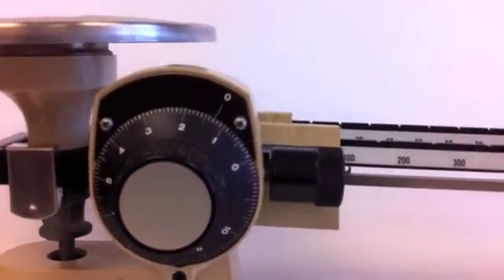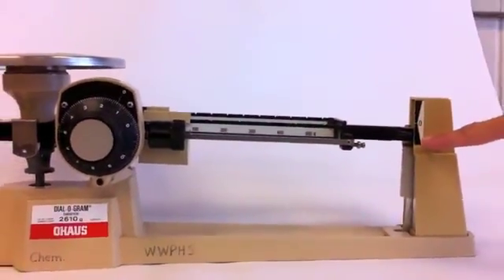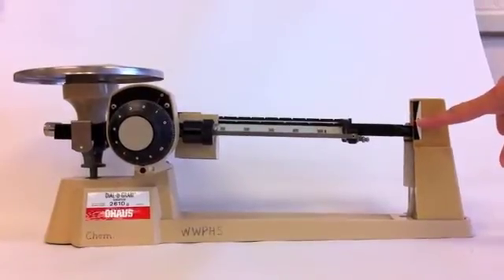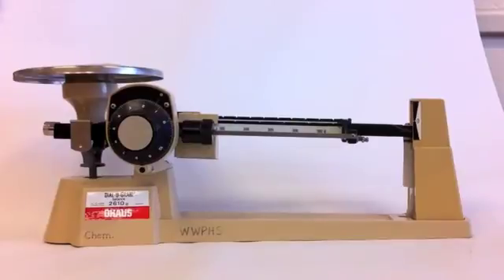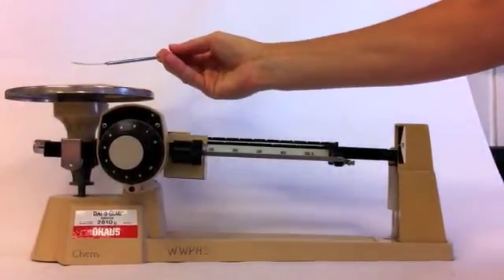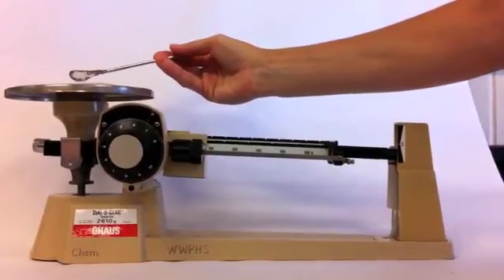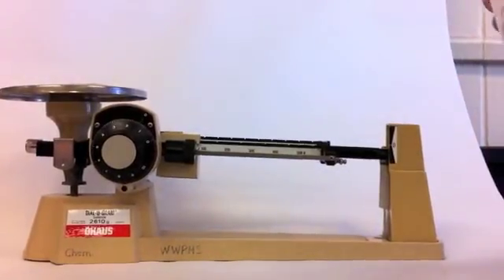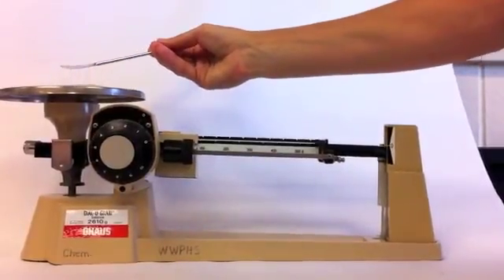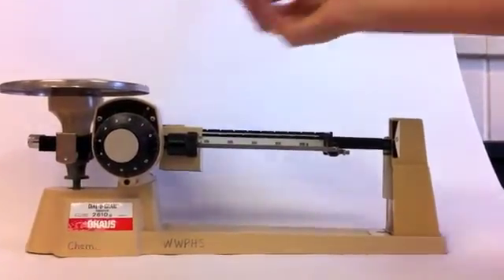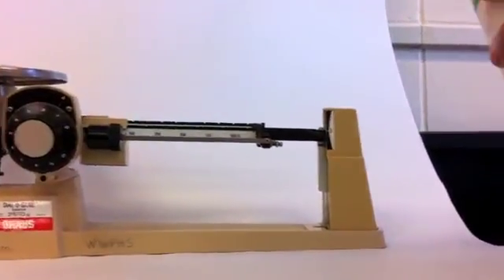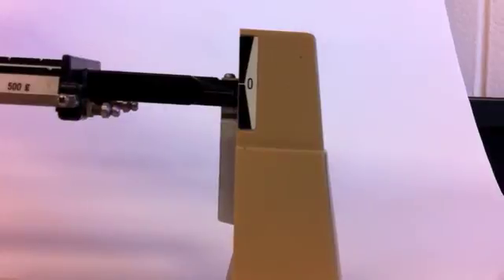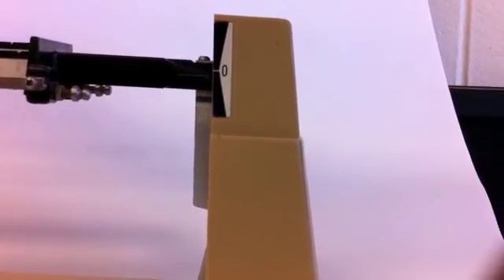You'll notice that the beam has sunk below the zero. As I add salt to my balance pan, that arm is going to come back up to zero. When it's at or very close to zero, I have one gram of salt. So, I'm going to add my salt a little bit at a time, keeping a close eye on my balance. We're trying to get right up or near the zero.